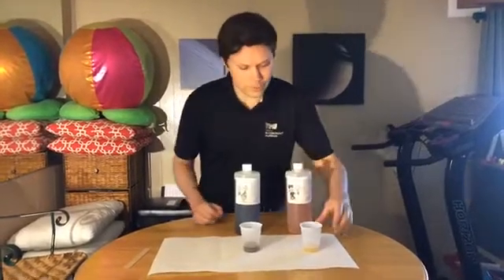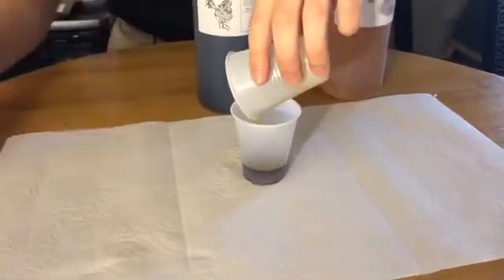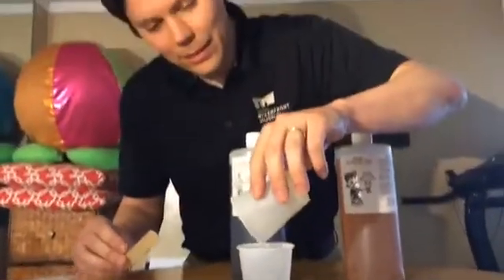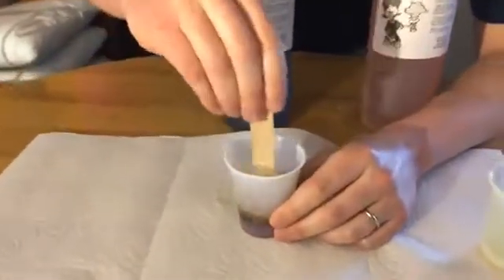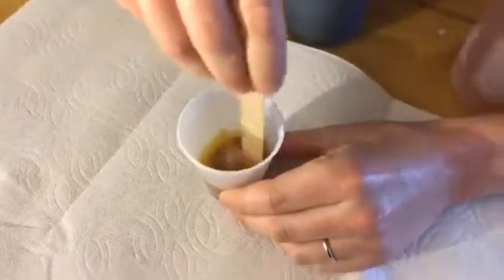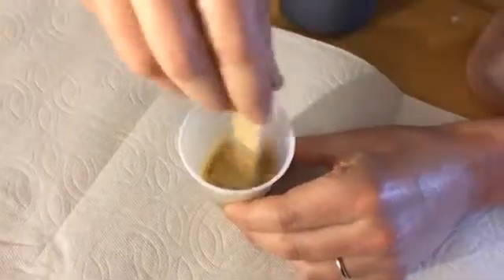So I'm going to pour the amine in the isocyanate, and I'm supposed to mix this together like 100 times. So you guys can count to 100 while I'm stirring this around at home. Stir this around 100 times and get all those atoms from both of the chemicals mixed together so we can make new chemicals.